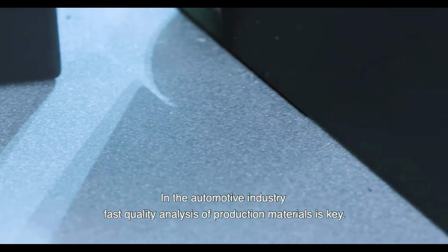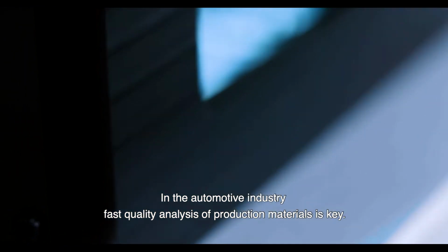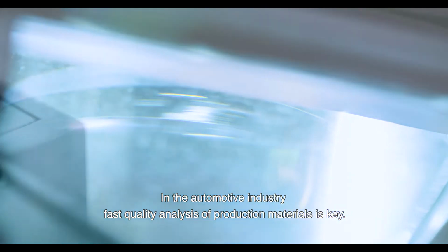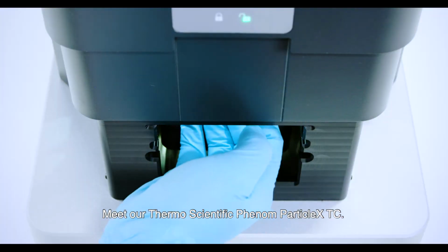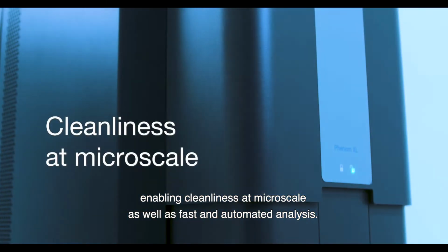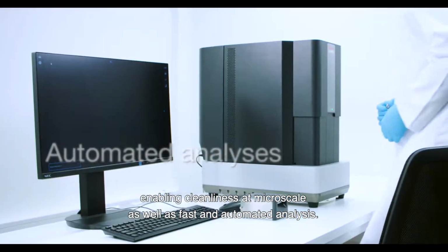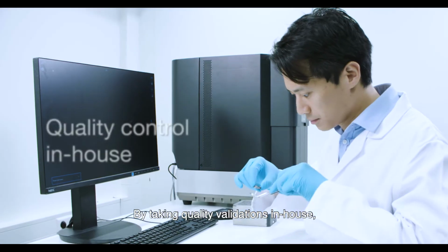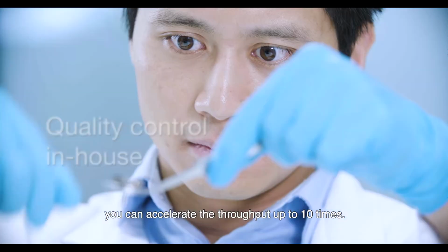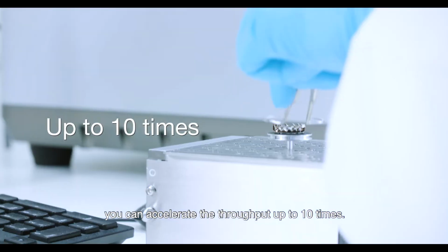In the automotive industry, fast quality analysis of production materials is key. Meet our Thermo Scientific Phenom ParticleX TC, the multi-purpose desktop SEM, enabling cleanliness at microscale as well as fast and automated analysis. By taking quality validations in-house, you can accelerate the throughput up to 10 times.